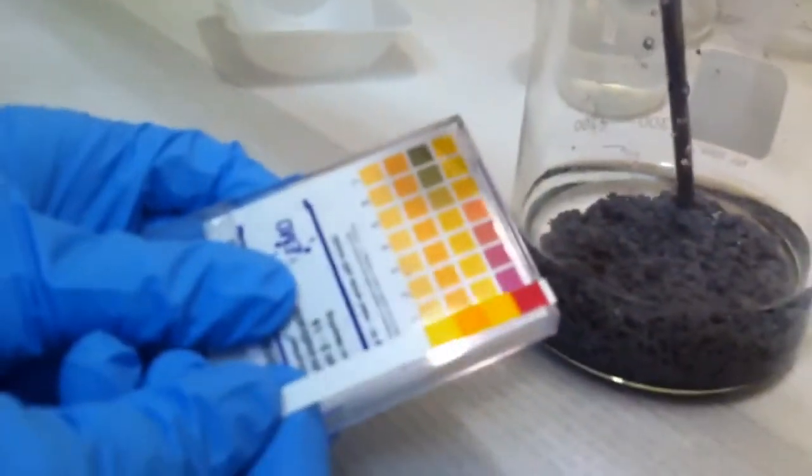Oh, my pH paper's nice and pink. There we go, it's acidic enough.